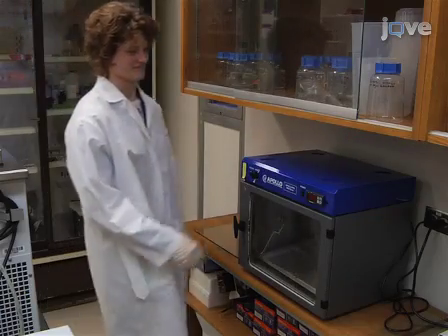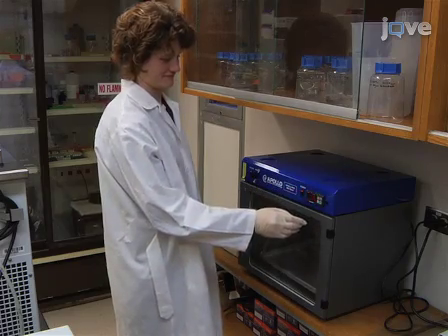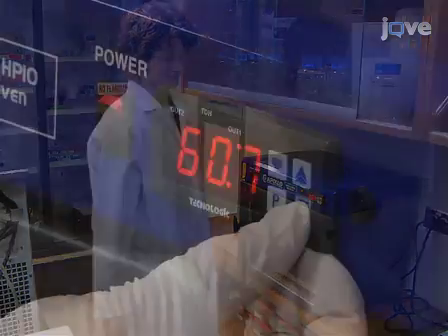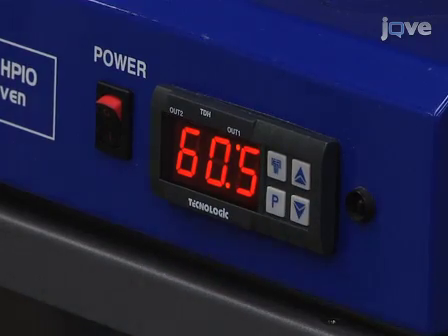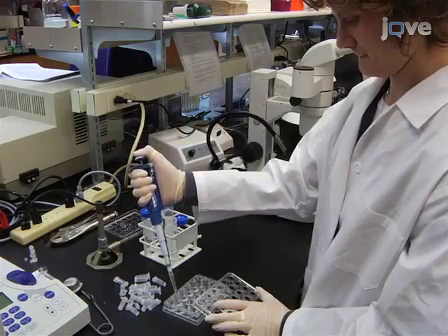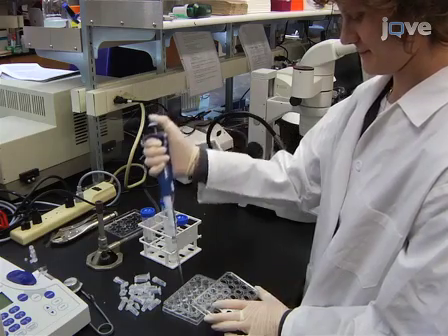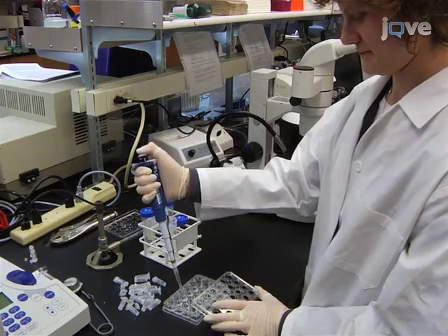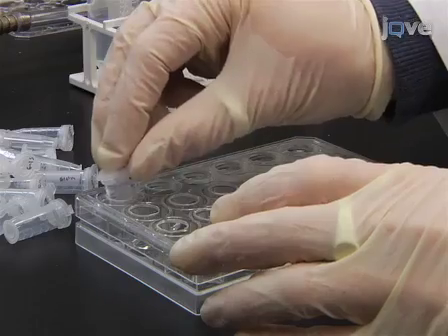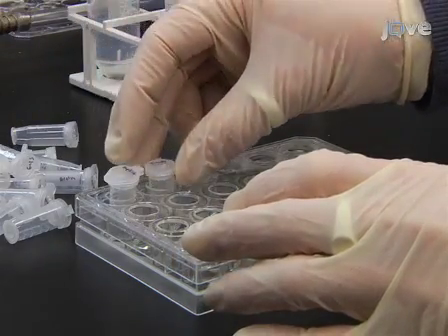Before beginning, start preheating a covered hybridization chamber filled with half an inch of tap water to 60.5 degrees Celsius. Begin the in situ hybridization by adding 2 ml of PBS-tween to each well of the 24-well culture plate. Cover this plate with the prepared lid loaded with baskets.